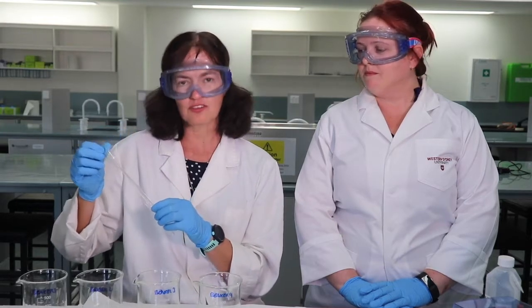So, in today's experiment, we will set up 4 beakers. And we will use dialysis tubing with different concentrations of sucrose and water to look at the rate of movement of water across membranes. Water should be small enough to diffuse through the pores in the dialysis tubing. Remember, it's made of cellulose and has pores of a certain size. We are interested in comparing the rate of diffusion of water, or osmosis, when we have a greater concentration gradient, so a bigger range of concentration differences between the bag and the beaker.